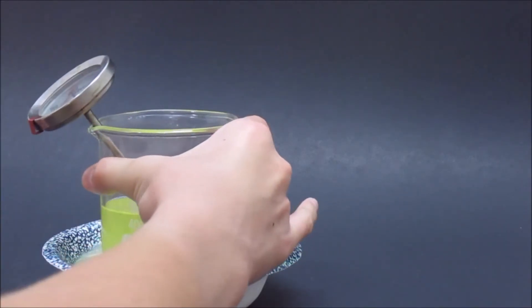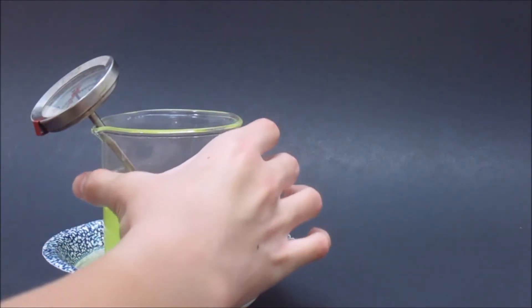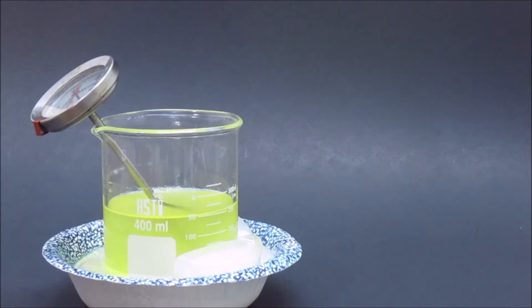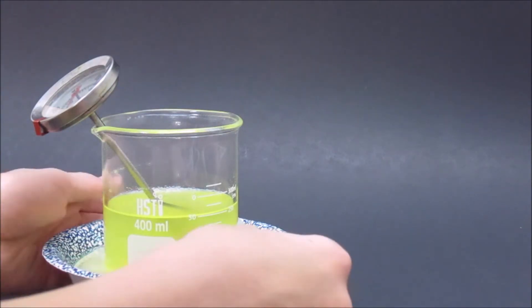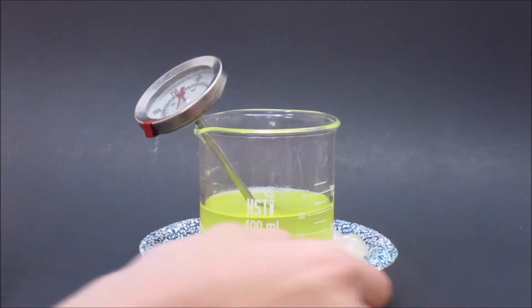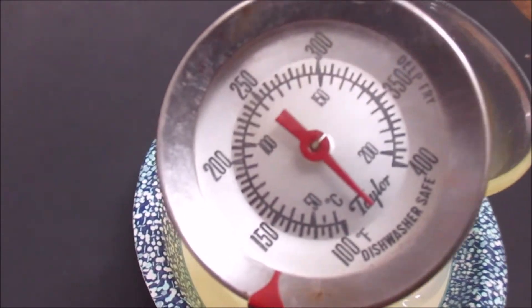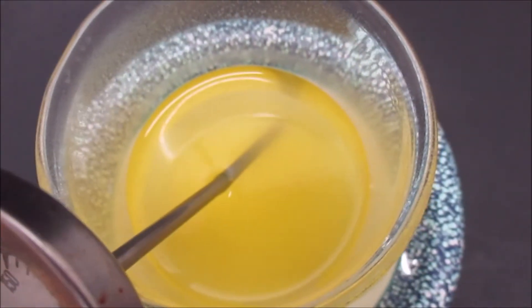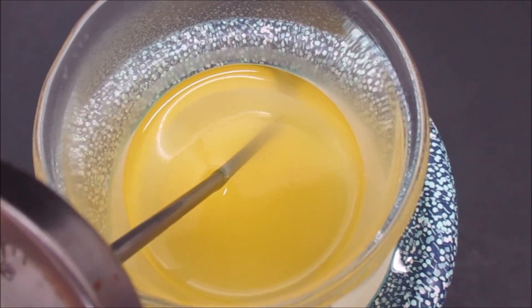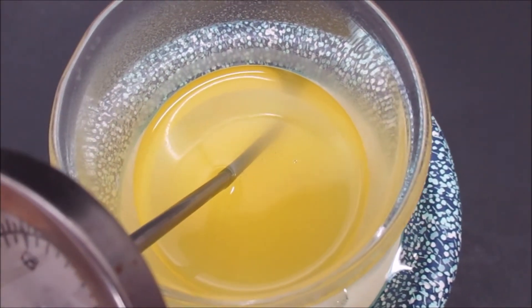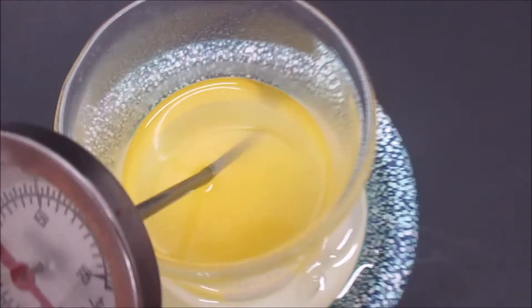If you're going to do this reaction yourself, don't be like me and add an ice bath after the reaction has gone more than halfway. You should add an ice bath when you first start the reaction. After a few minutes, the thermometer did not say it was hot enough to boil chloroform, but still, better safe than sorry.